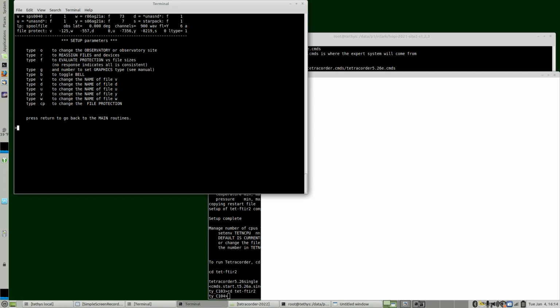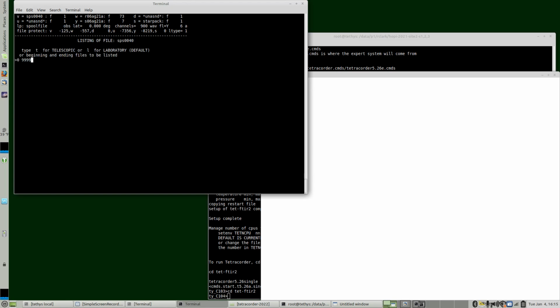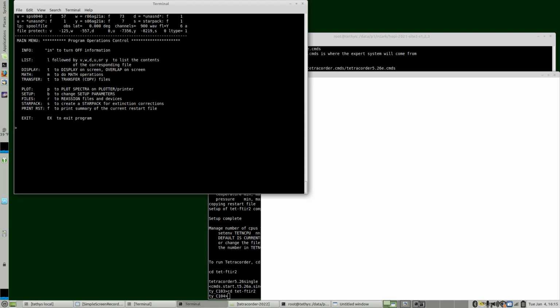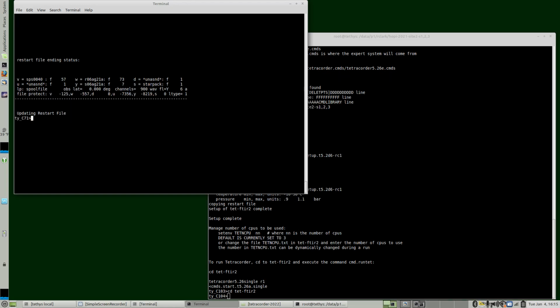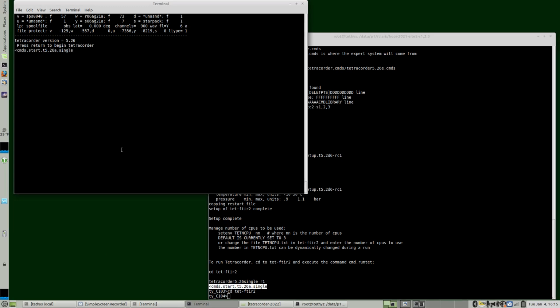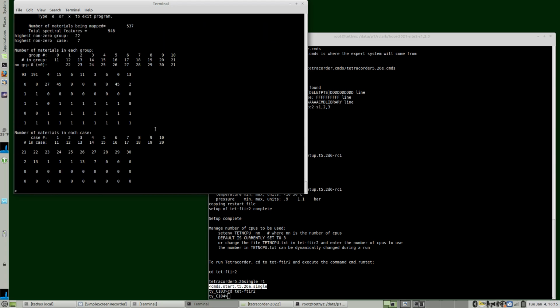Now we're all set up and ready to go. Let's list V so we know which spectrum we want to look at. So the spectrum was this one here that identified hydrogen peroxide, so it's V30. So now we're all set to run Tetracorder. We can exit spec.pr. We can start Tetracorder here like this. We have to read in the expert system. We do that here. Okay, now we're set.